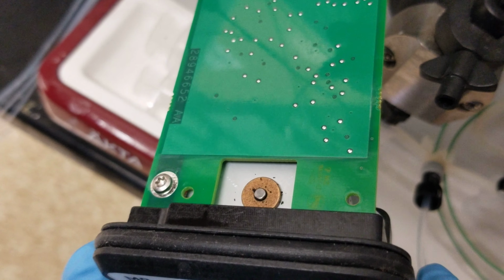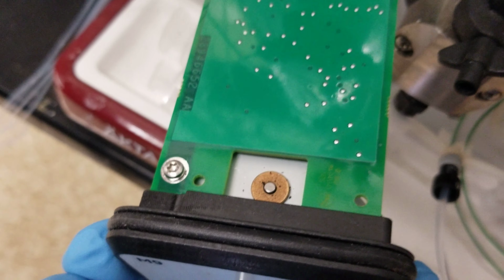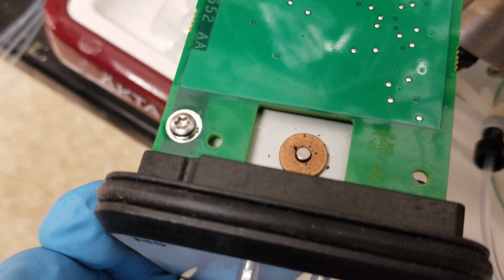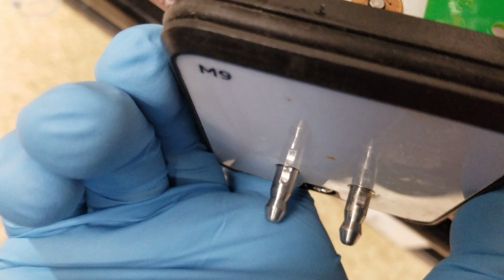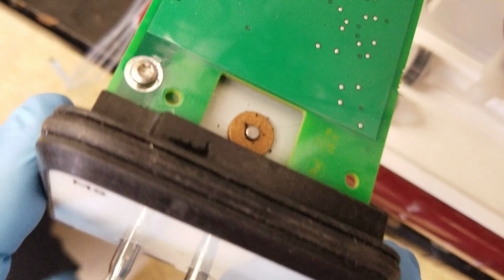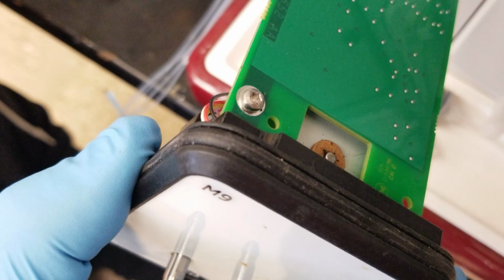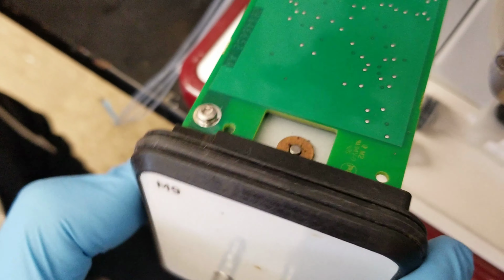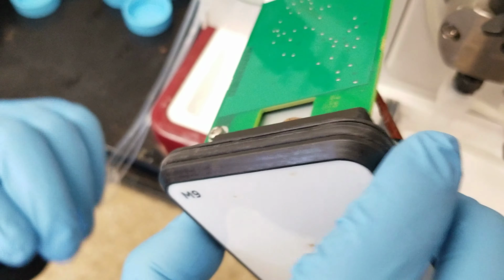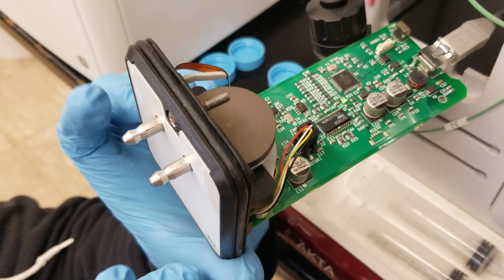Wait a second. I just heard that noise. Here you go. That's the noise. What about this piece? The piece that's moving here is touching. Let me see if I can. It's hitting something. It must be. Flip it down. Flip it up. Okay, the noise is going to go away, because the way it's supposed to run is like this. Because it's upside down right now.